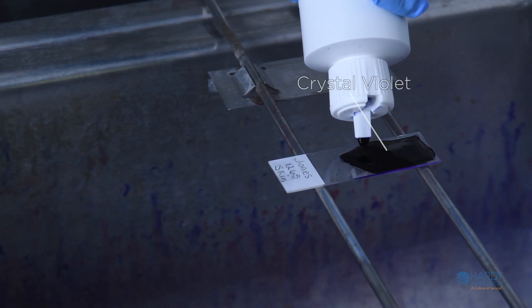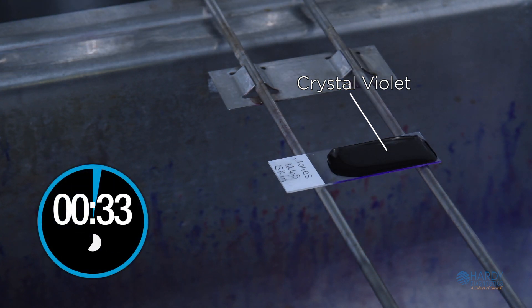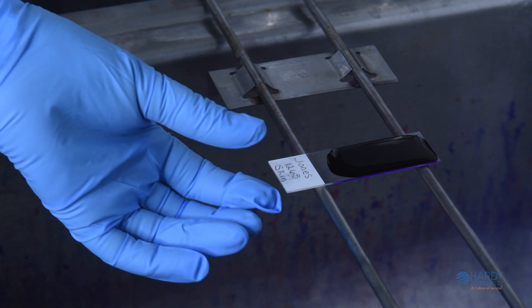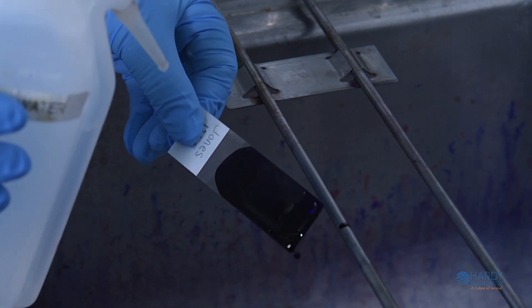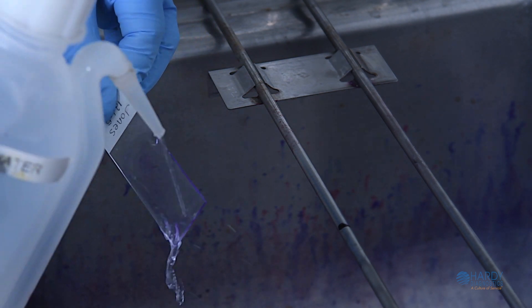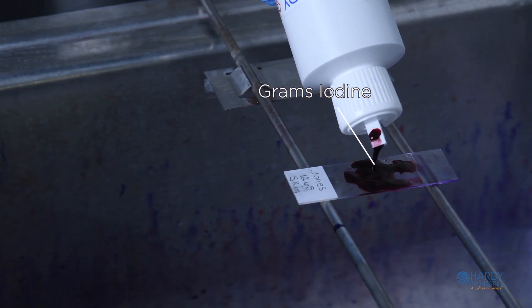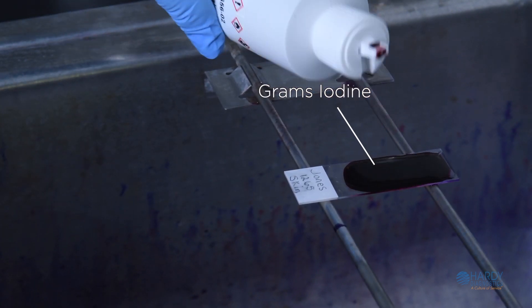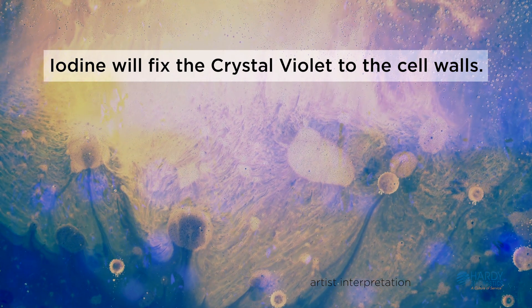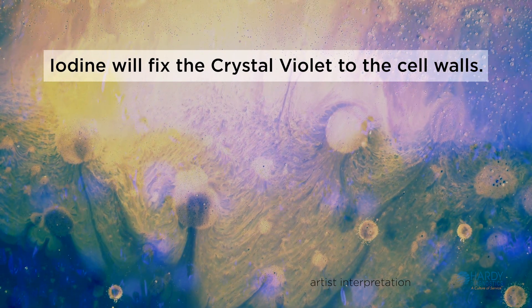Cover the slide with the primary stain, crystal violet, for one minute. Crystal violet is a dark blue to purple dye that stains all cells. Rinse the slide with deionized or tap water to remove excess crystal violet. Then flood the slide with Gram's iodine for one minute. The negatively charged iodine molecules act as a mordant and link to the positively charged crystal violet, trapping the crystal violet in the peptidoglycan layer.